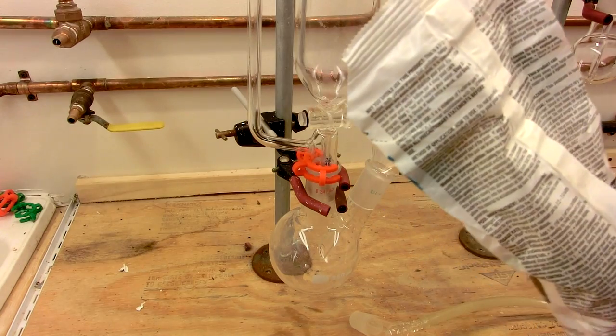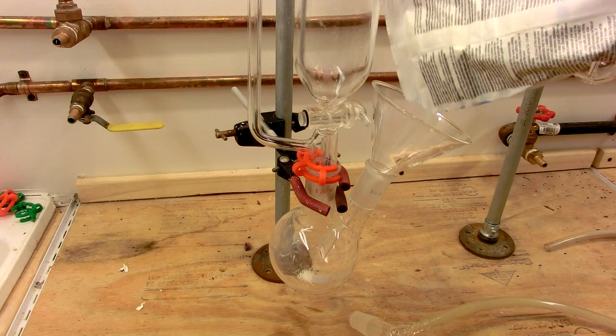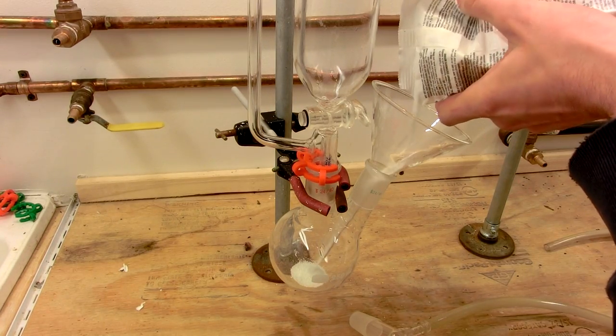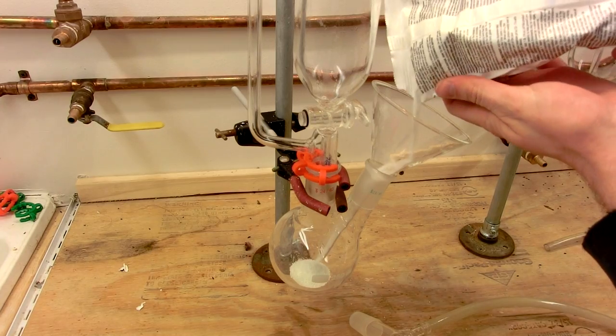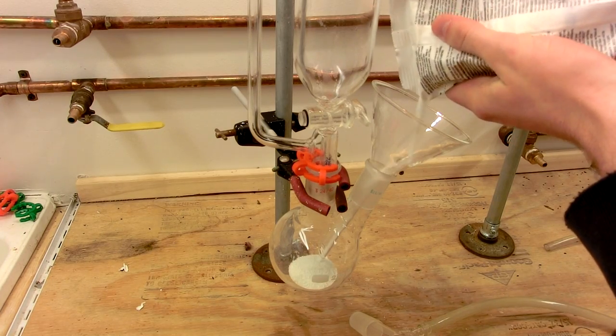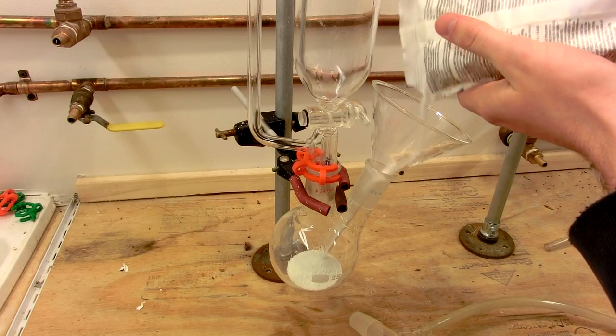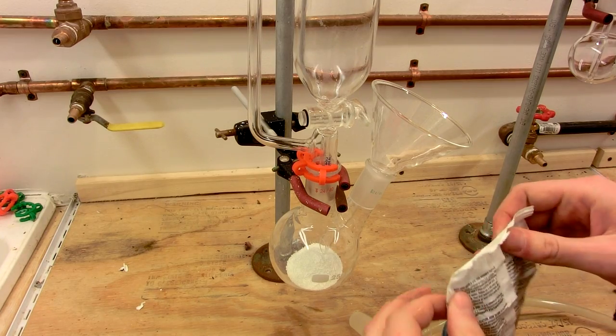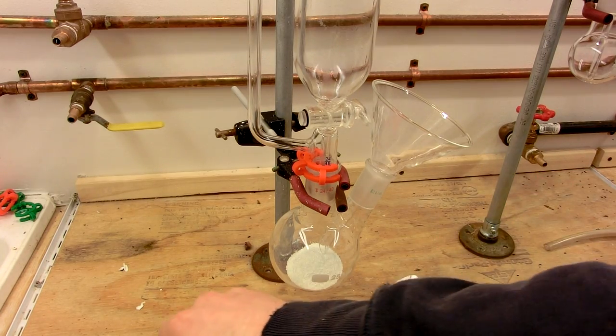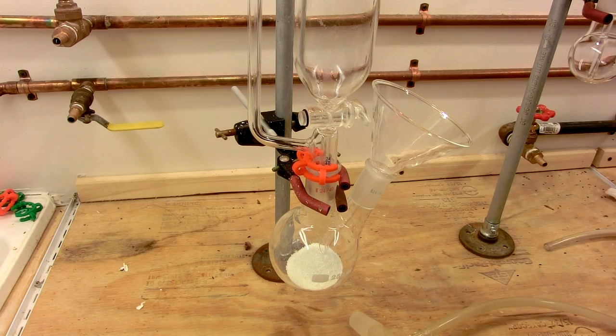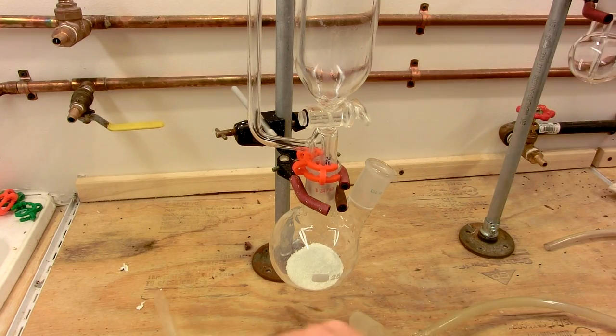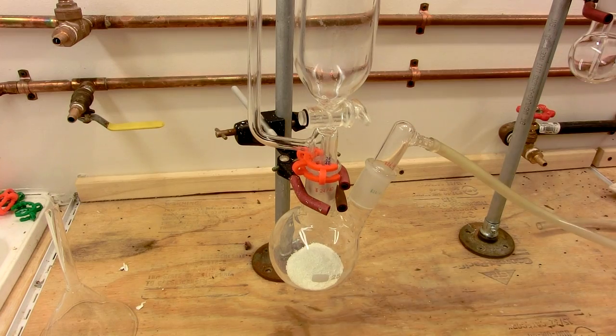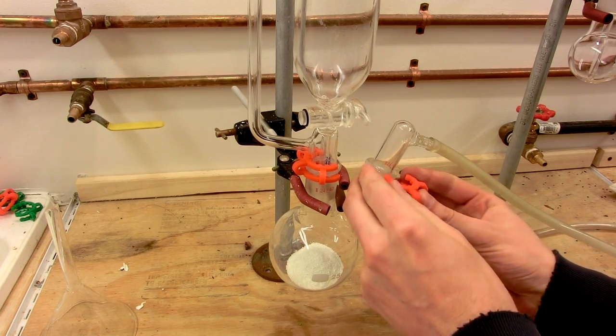So I've cut a small corner off this bag. And it's a slightly greenish granular substance. I believe it's got sodium carbonate in it as well, maybe some calcium carbonate, I'm not quite sure. But that should be sufficient for today's demonstration. We'll roll this back down, remove the funnel, it already stinks like chlorine in here. Attach our gas takeoff port and secure it with a clip.